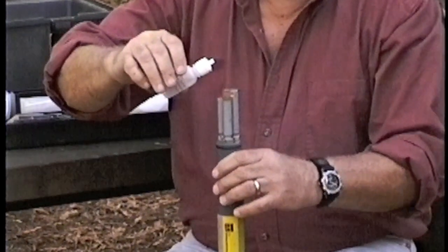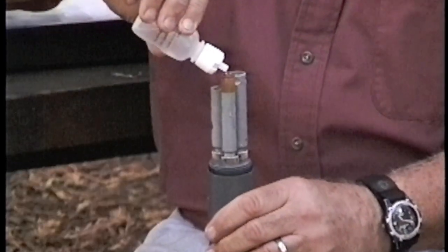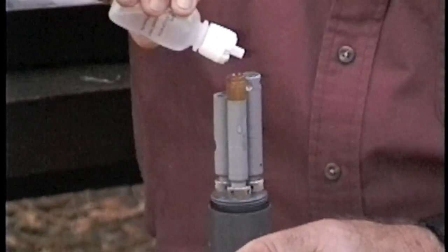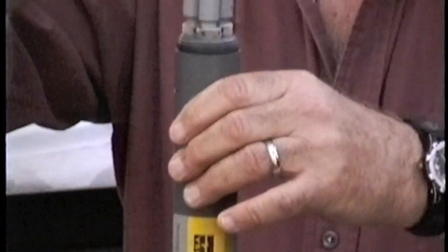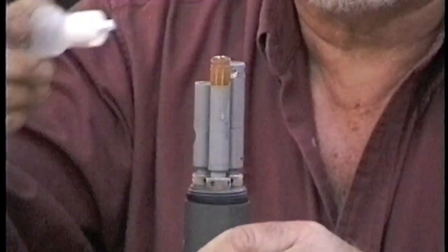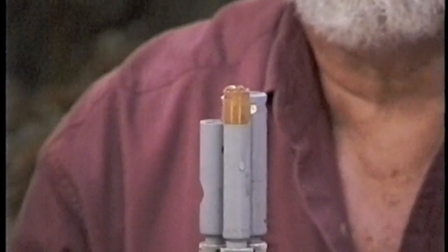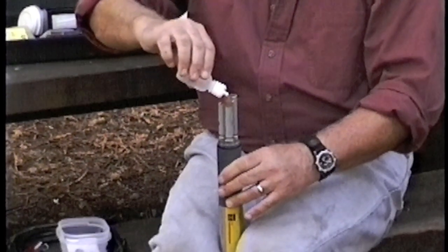The electrolyte is then put on the dissolved oxygen membrane until it forms a positive meniscus. There's a tiny bubble — we don't want any bubbles in there. You can see that positive meniscus. I will then put a little more on there.